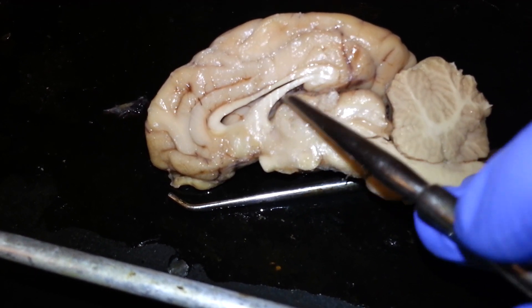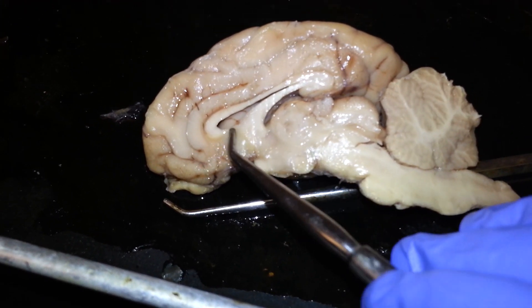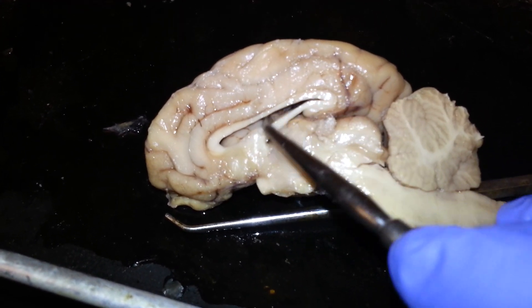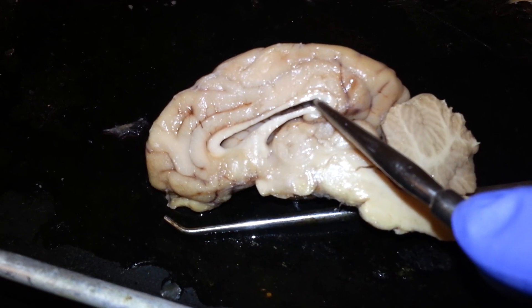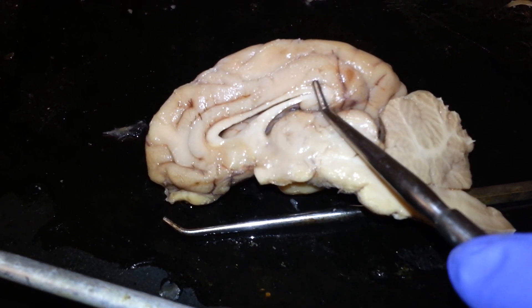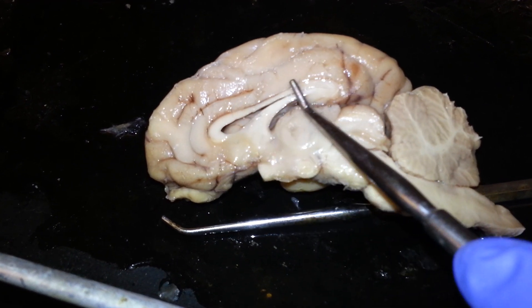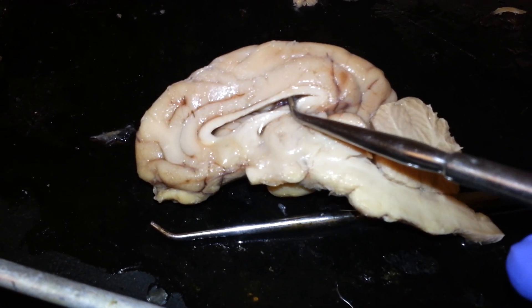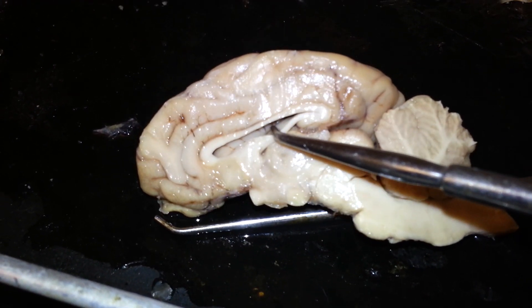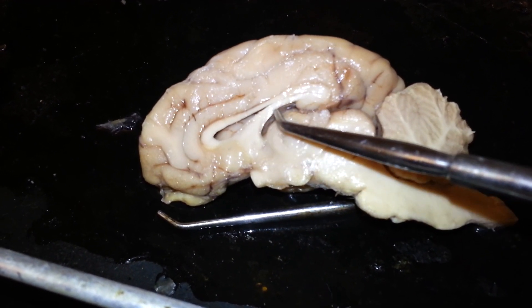Superior to the thalamus, we have the third ventricle right here where I'm sticking the probe. Then we have the lateral ventricle right here — this space. In class, we talked about the lateral ventricle being similar to a room. The curtain that separates the two rooms, or the two ventricles on the right and left hemispheres, is called the septum pellucidum. We tore that away so that you could see the space in the ventricle inside. This part that I'm pulling down on so you can see the space — this tissue right here is the fornix, or what would be the floor of the room.